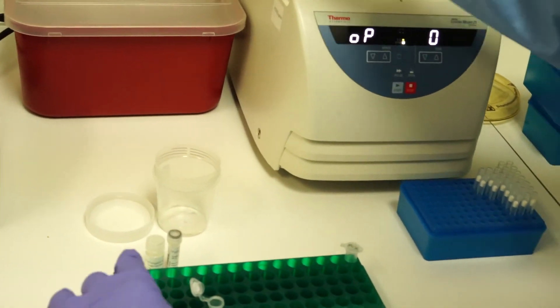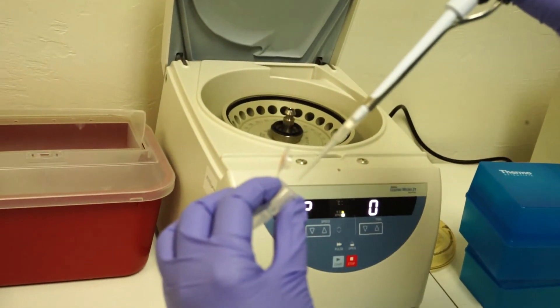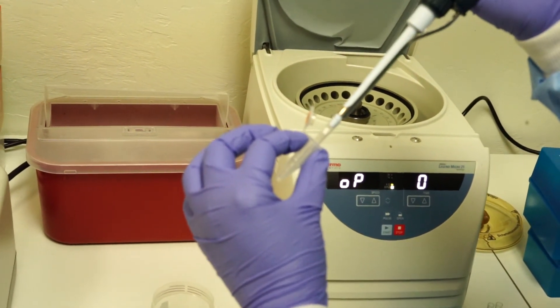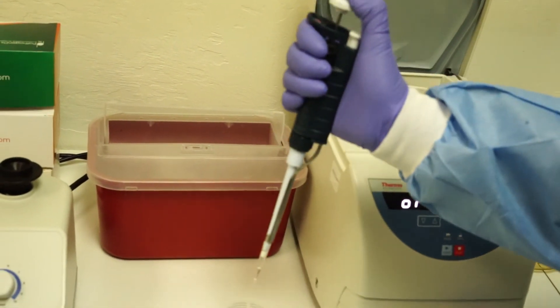Carefully pipette to avoid the pellet and if no pellet is observed, remember which way the tubes were oriented and imagine the pellet on the side of the tube. Most of the liquid must be removed in order for sample lysis to occur.